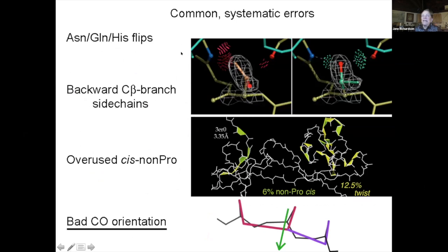And what we're particularly interested in is what we think of as systematic errors. They're features of a map that are misleading, or can be misinterpreted really easily, either by people or by programs. And so we started off doing asparagine, glutamine, and histidine flips a long time ago, and then looked particularly at backwards beta branch side chains, where if the density is sort of straight across or even not there, you can easily fit something 180 degrees backwards. And that's a doubly eclipsed bond angle at that point, bond dihedral. They're less common now that we made a big deal over them.